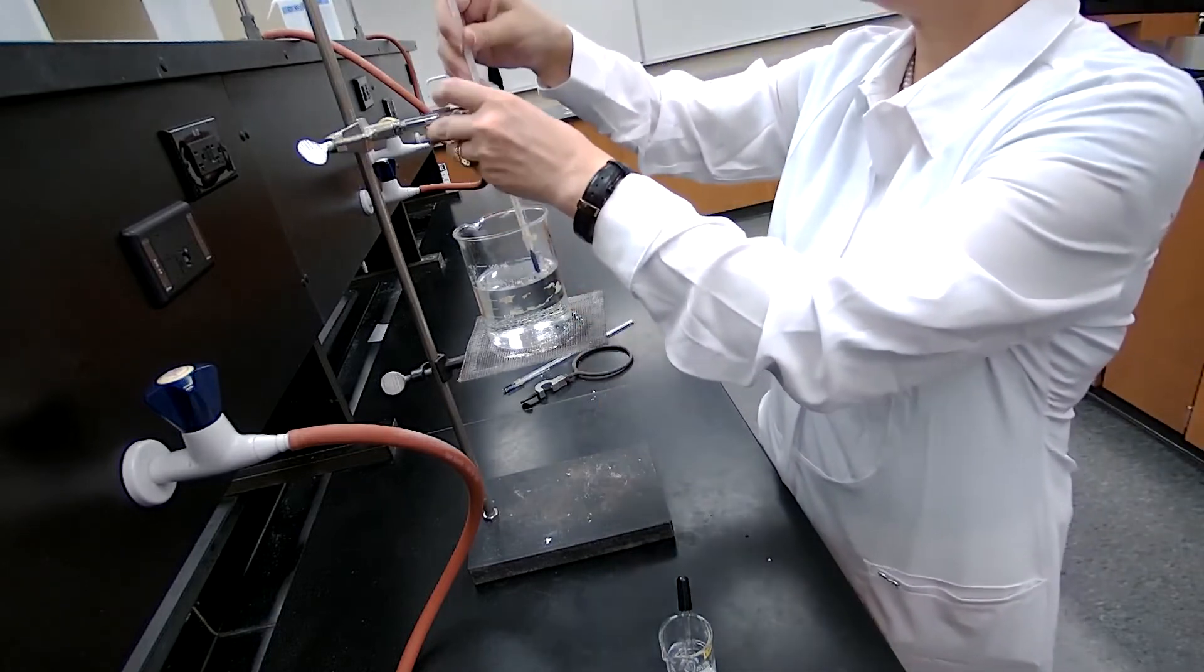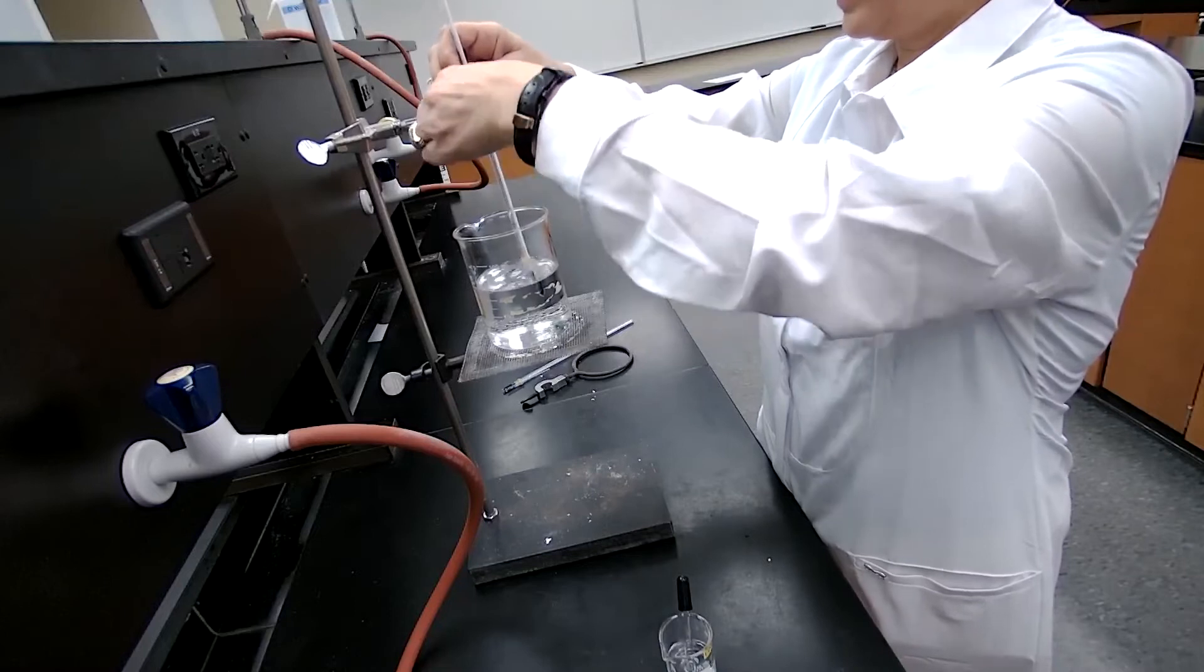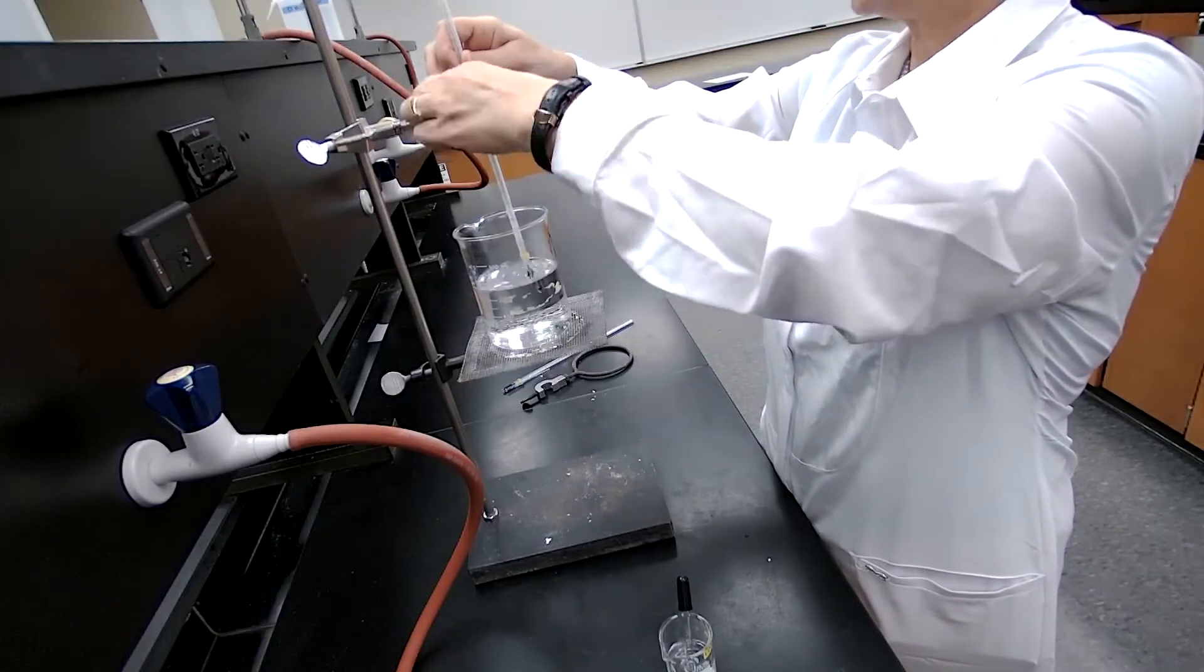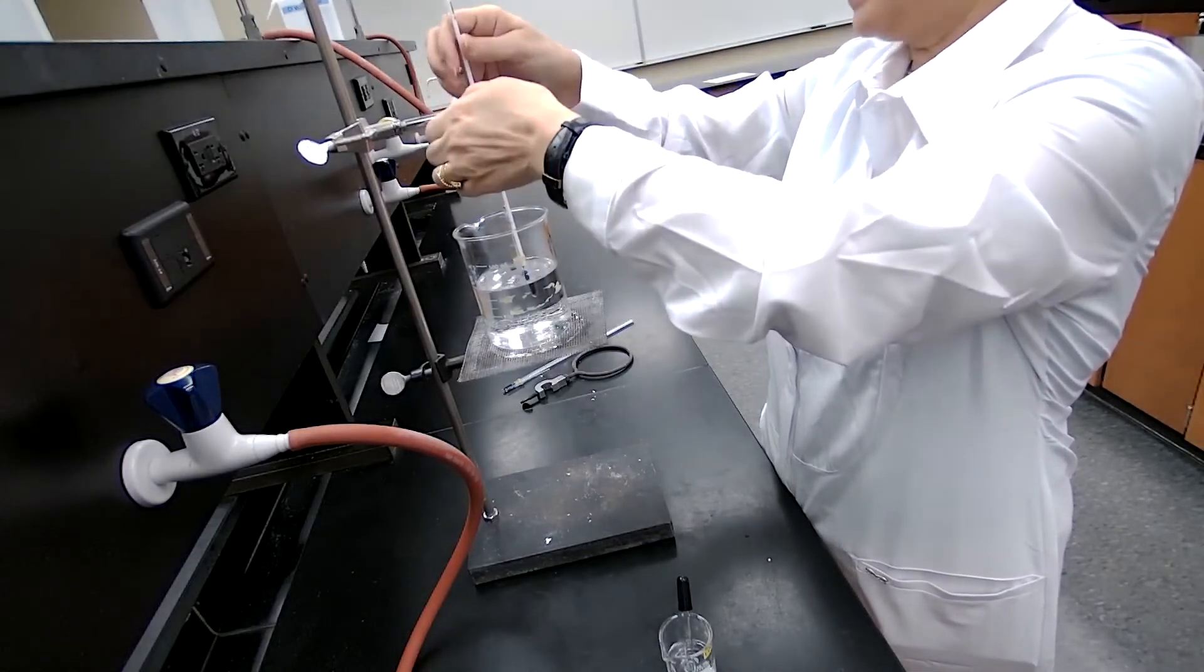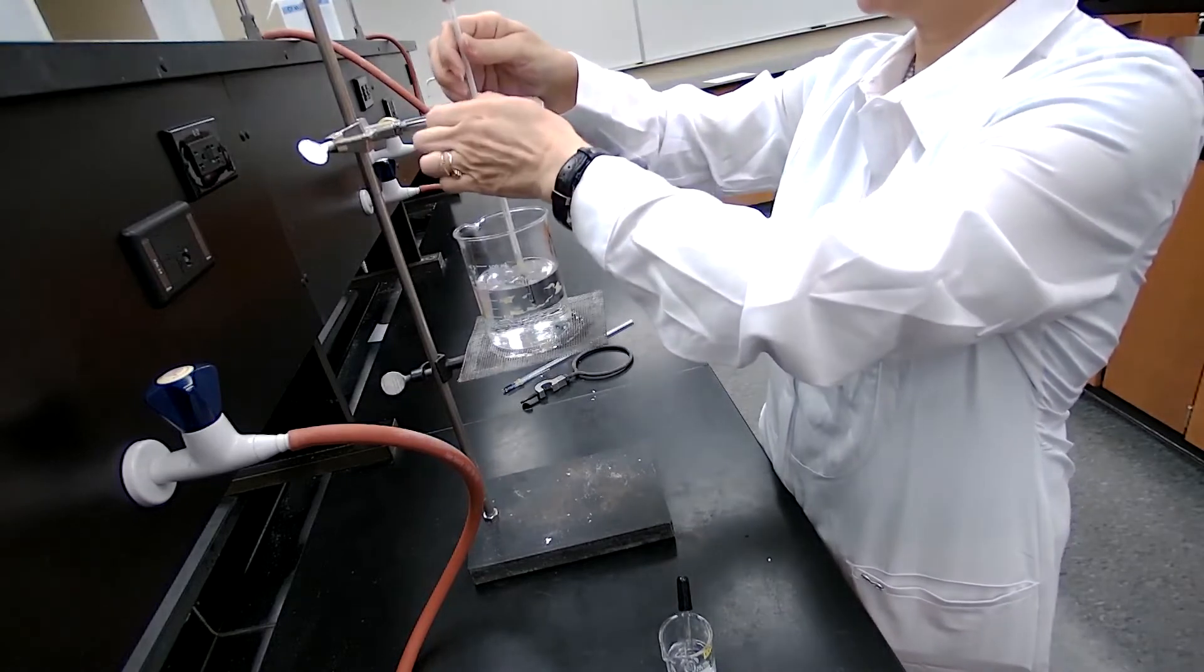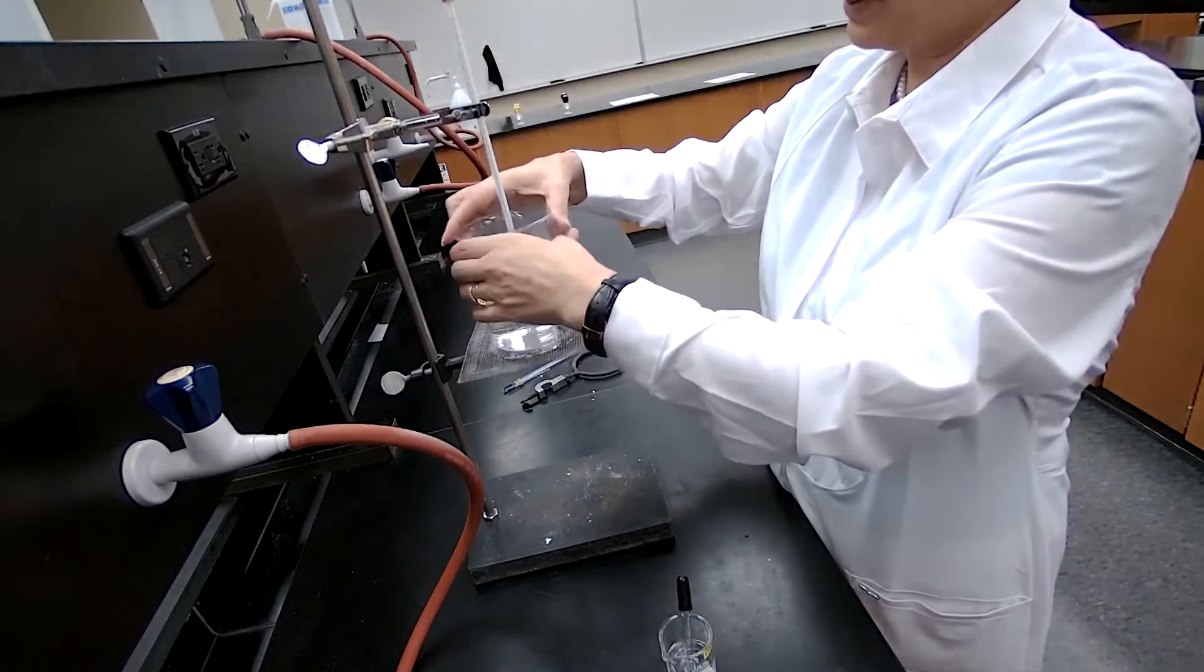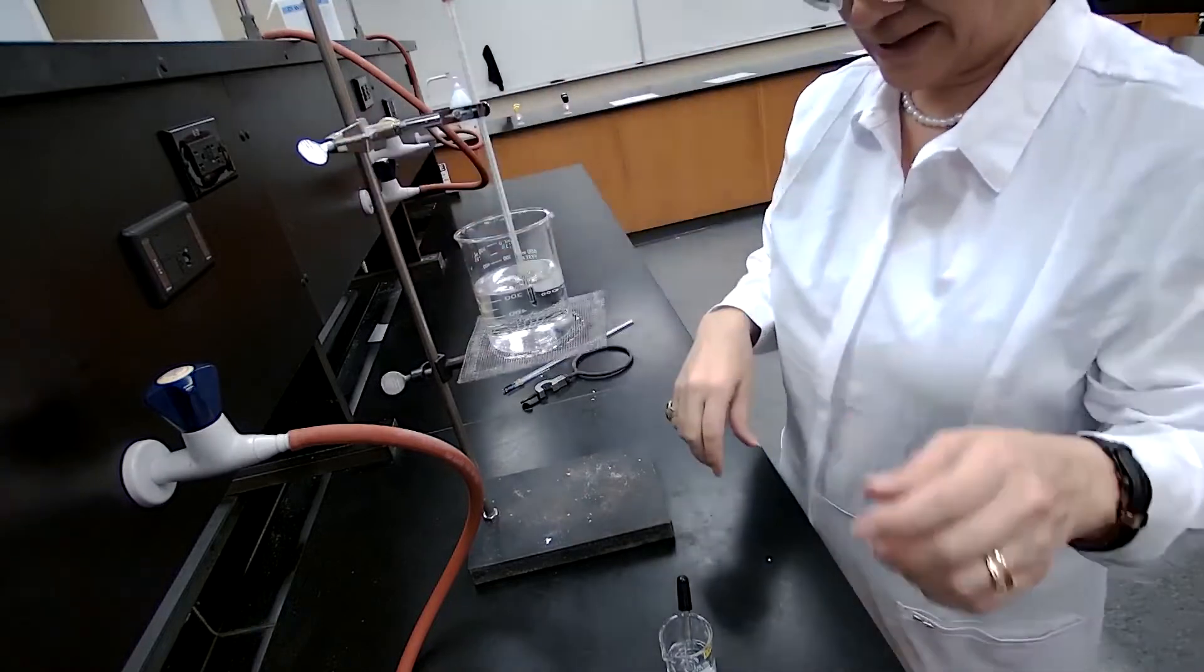So I'm going to secure that to the clamp, the thermometer clamp. Each clamp is different, so we do use different clamps, but we want to make sure that we are using the thermometer clamp.